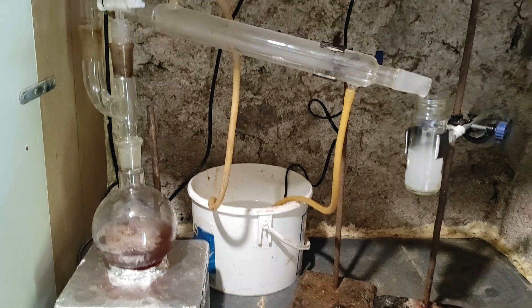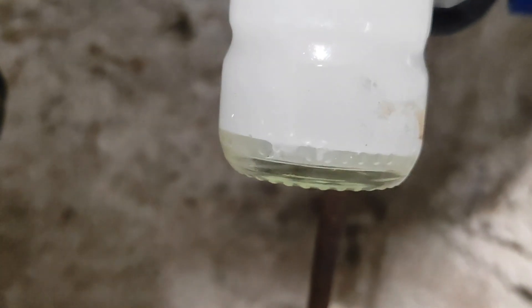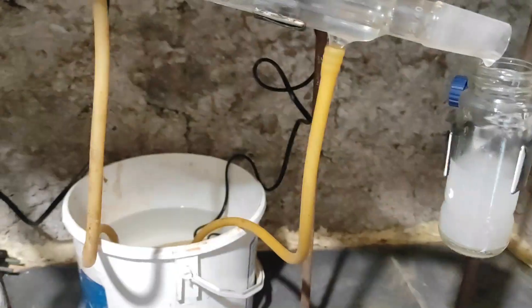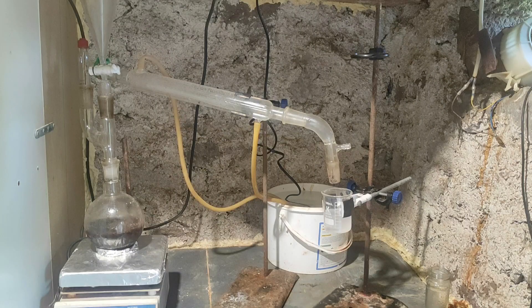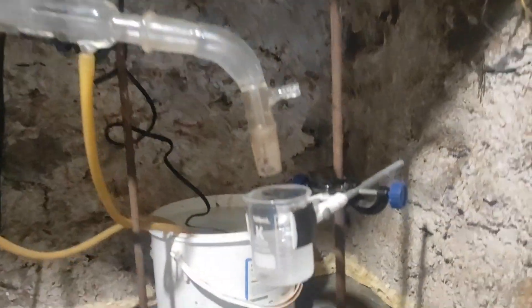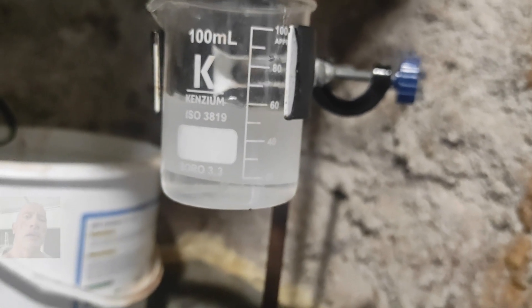Anyway, I had this video to make, so I decided to just transform myself into a siphon, and for the next 3 hours I manually retrieved the toluene back to the reaction flask, leaving the water behind. The clear water layer is on the bottom and the cloudy layer is toluene because of the water inside it. Over time, the mixture gradually turned more yellow-orange, then red, and then dark. So now that I've done all this by hand, I can tell you that it's not worth it, because apparently a normal reflux also works decently well for the reaction.